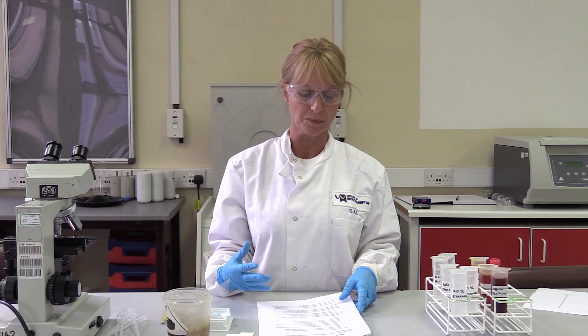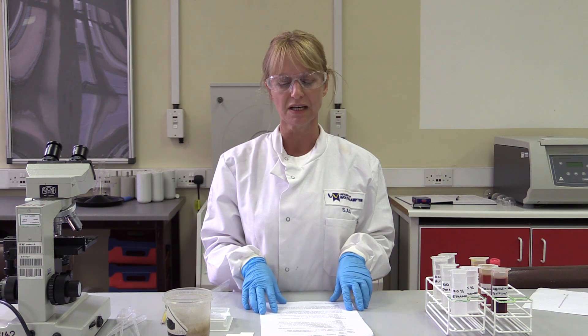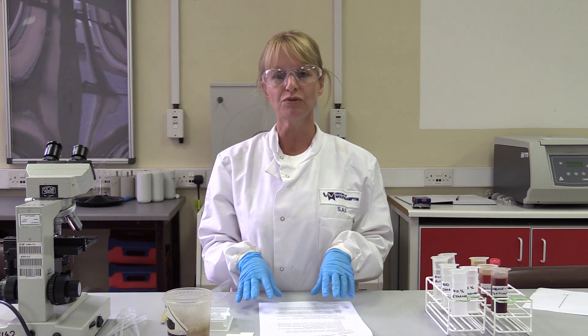Starting with Practical 1, which is the cytology sample, the learning outcomes are for you to be able to prepare a cytology sample, stain it, understand the different stages of the stain, and then identify the cells. You've all been given a sample from one of the local hospitals — it's a real sample, already reported. It's a cervical cytology sample. Your task is to prep the sample, stain it, and identify whether the patient had an abnormality in that sample.